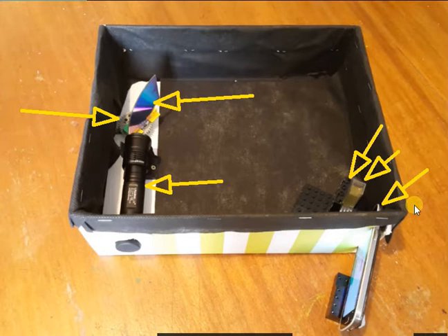This is the most fiddly bit, to be honest, getting this in the right position. But once it's set you're okay. Obviously if you make your own, the dimensions, the angles and everything, are going to be different because you're going to be working with a different torch.